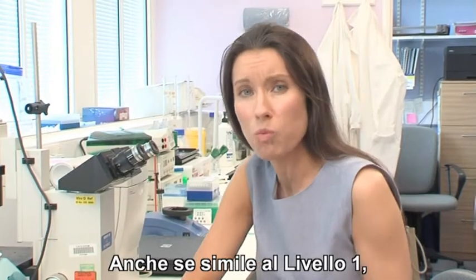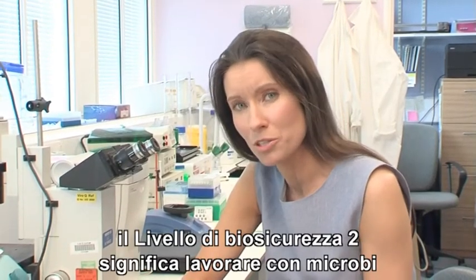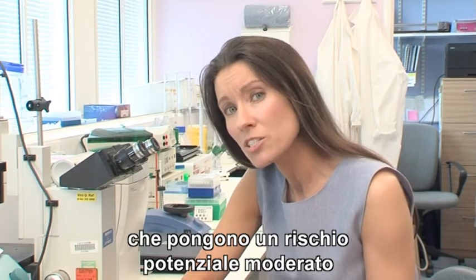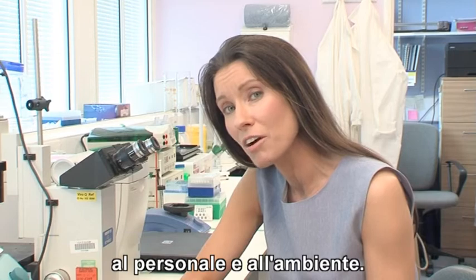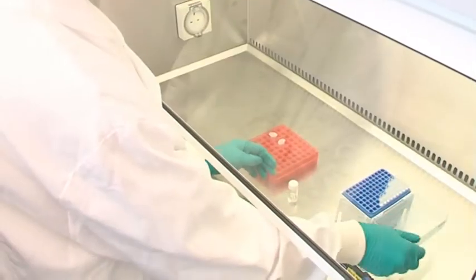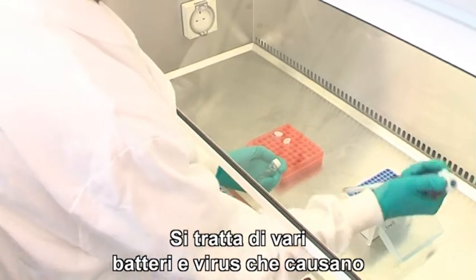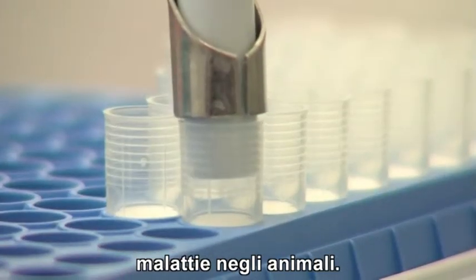Although similar to Level 1, Biosafety Level 2 involves working with microbes of moderate potential risk to laboratory personnel and the environment. It includes various bacteria and viruses that can cause animal disease.